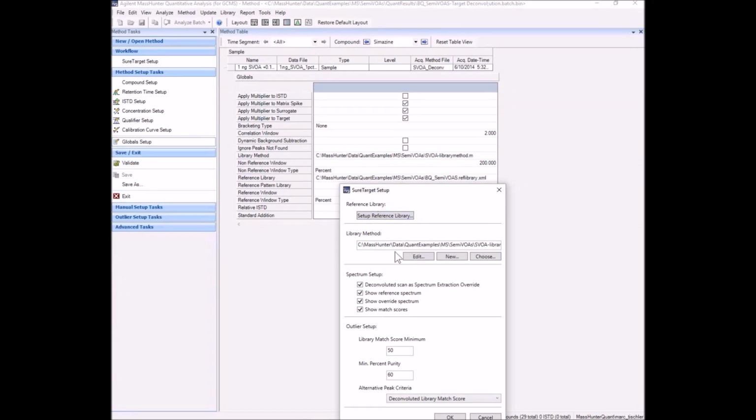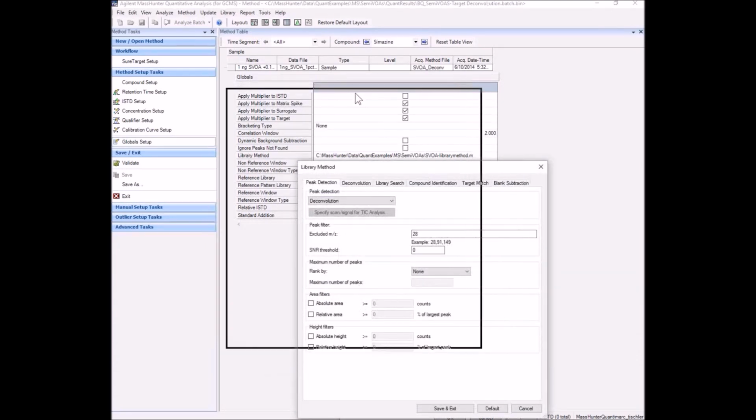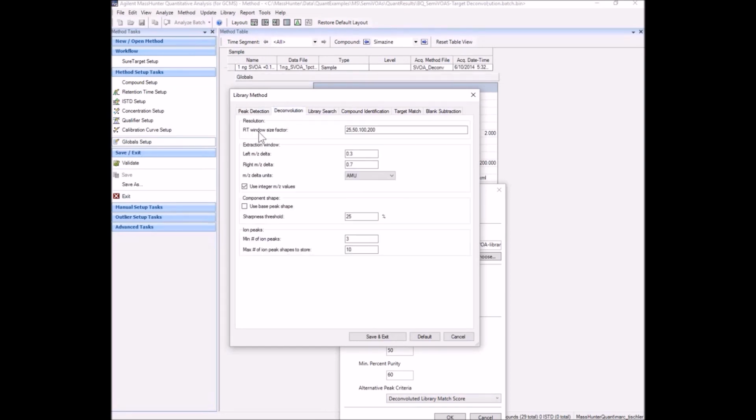So let's take a look at the library method that is set up here for target deconvolution 2. For the peak detection algorithm in the library method, we're using deconvolution. That provides the clean spectra. Deconvolution has a lot of choices here, and we'll leave those as the defaults.